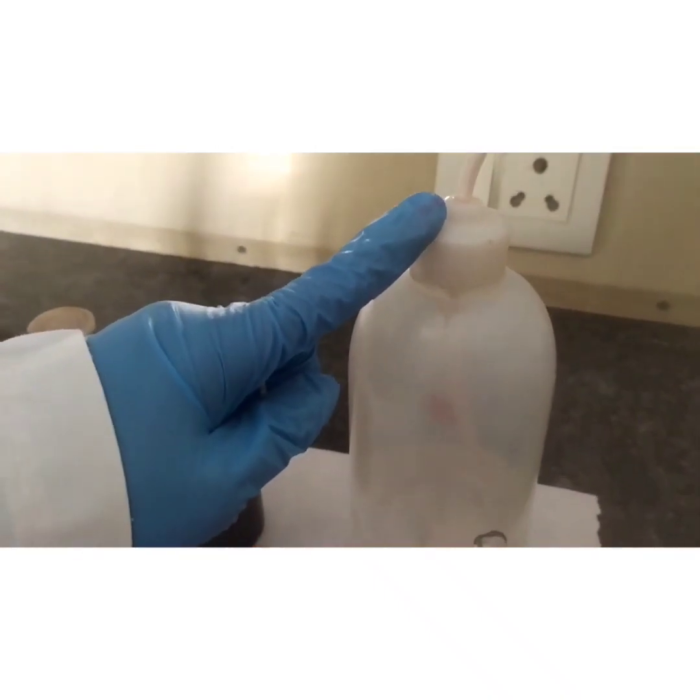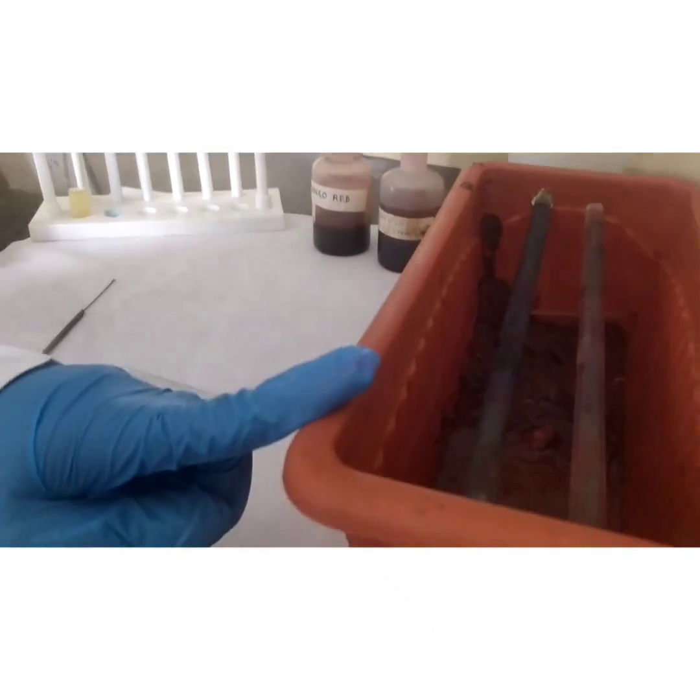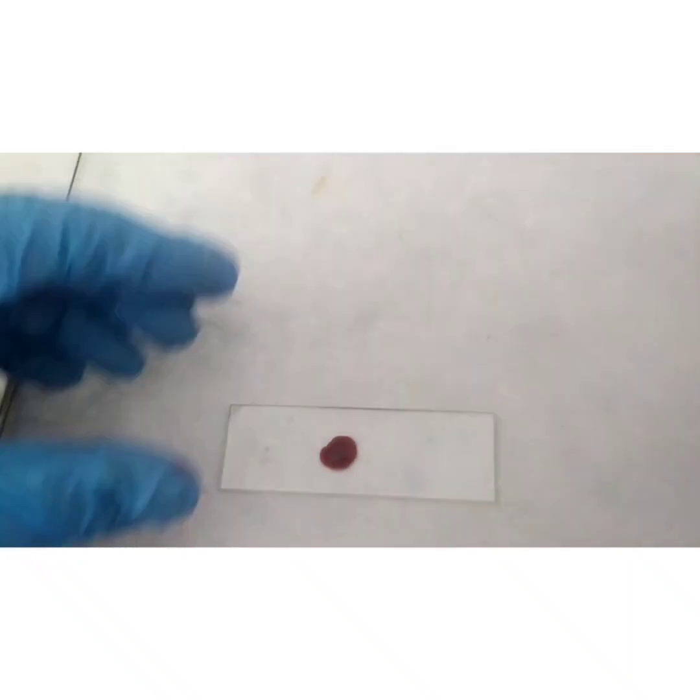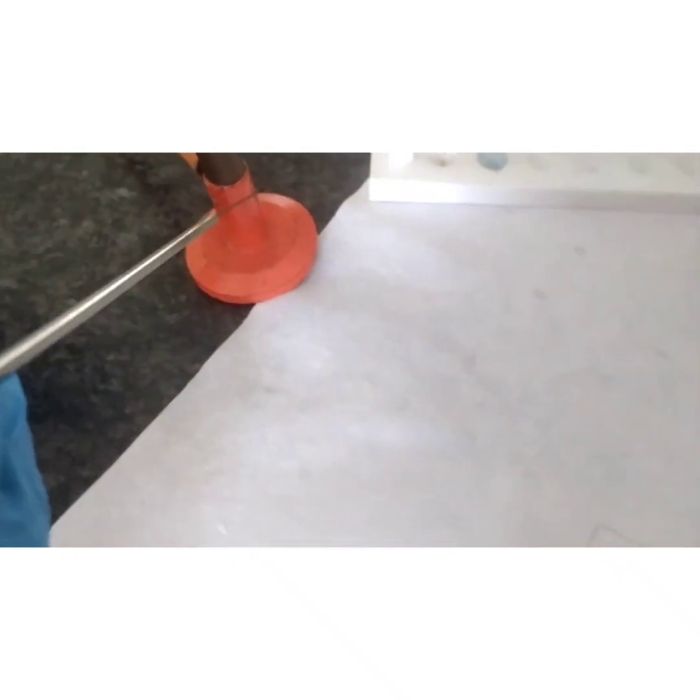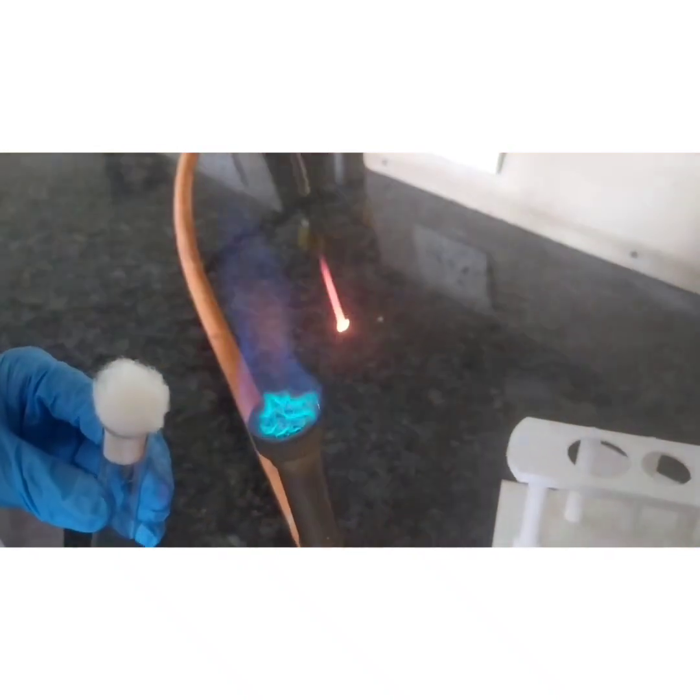We also need a wash bottle and staining rack. The procedure is: take a glass slide and add one drop of Congo red. To this add a loopful of the organism. Before that, mix the bacterial culture well and sterilize the inoculation loop by incineration. Cool the loop.